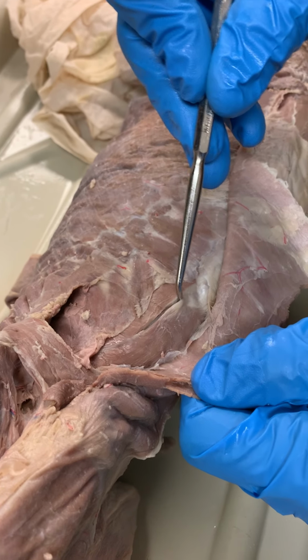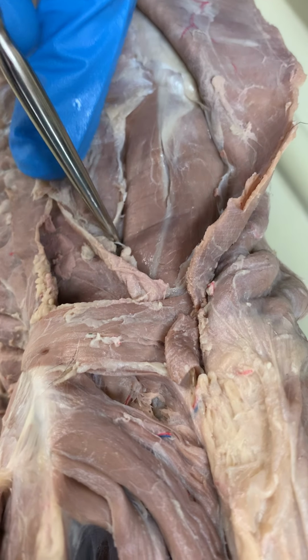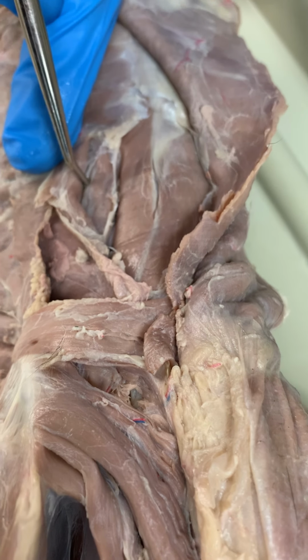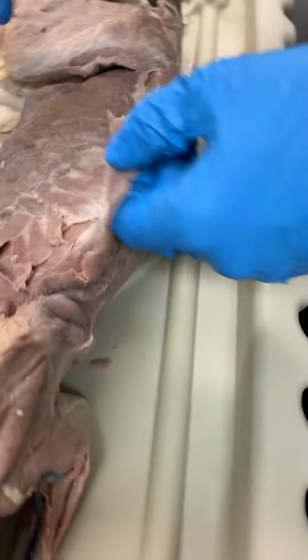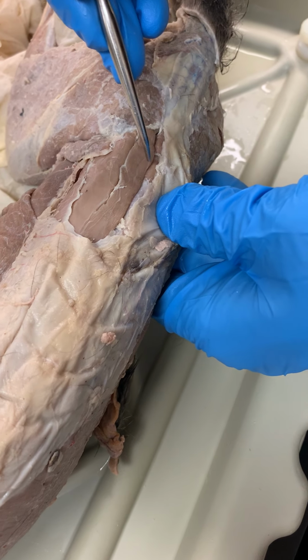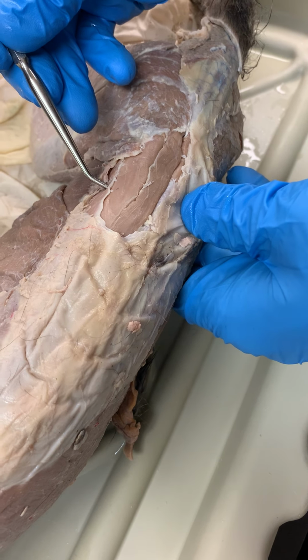Here we have two of our three erector spinae muscles showing very nicely. Spinalis dorsi, longissimus dorsi, and if we fold back our serratus dorsalis, we can see iliocostalis. And I think you can see this on the film. Here we see little white tendons going to each rib, which is the insertion point of our iliocostalis. On the lower back, we can see our erector spinae group again, right along the vertebra, multifidus spinae, and all of this is longissimus spinae. We have our medial, intermediate, and lateral cords, if you will.